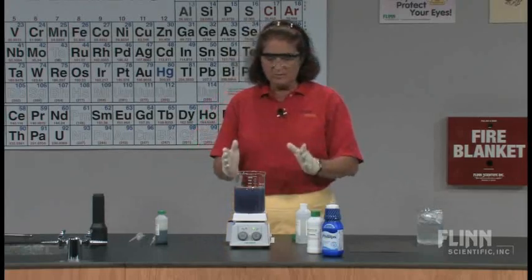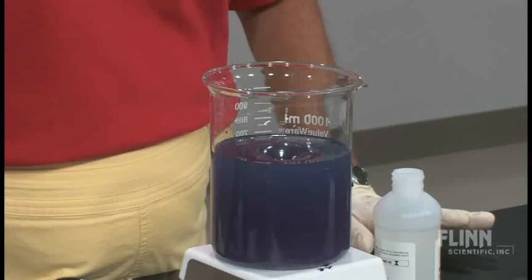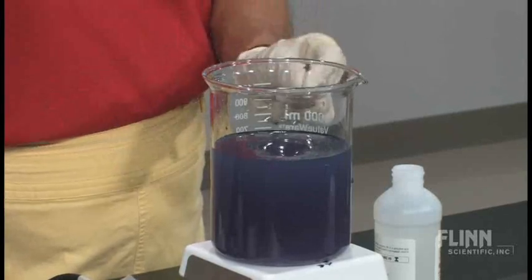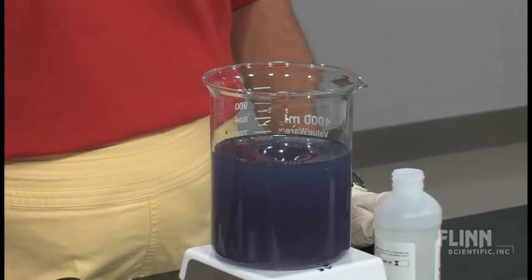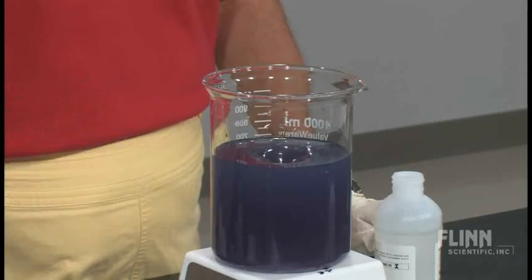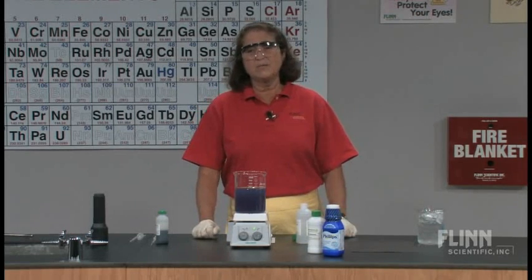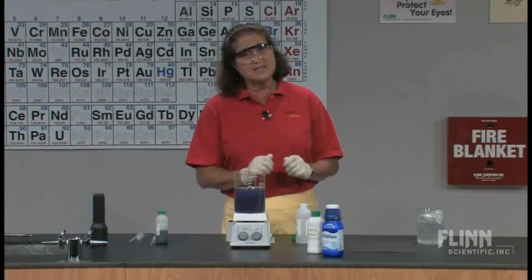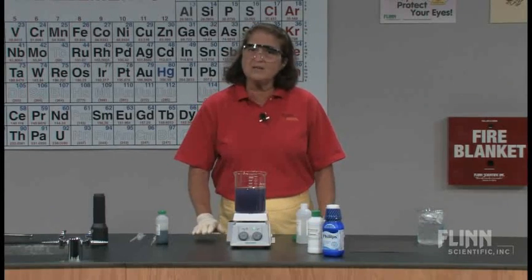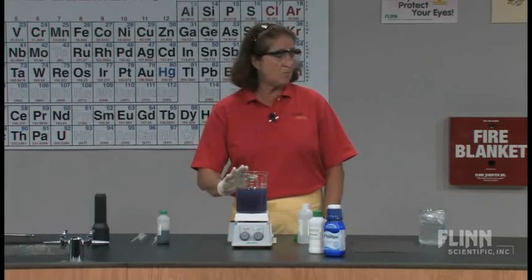Going back to our beaker, we see that even though when we left it previously it was more towards a blue hue, now we've gone back to purple. What happened was the magnesium hydroxide neutralized the acid, and for a while it stayed sort of blue. Then it goes back to purple at about a pH of 10. This is happening because once the magnesium hydroxide was consumed in the reaction to neutralize the acid, it took a little bit of time for more magnesium hydroxide to dissolve — it's not very soluble in water.